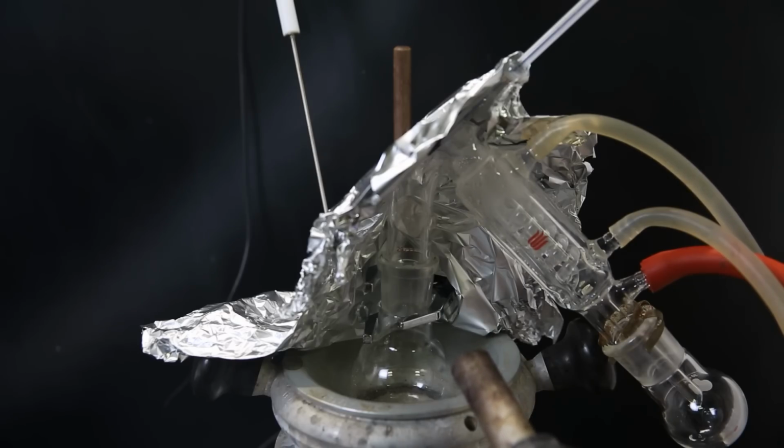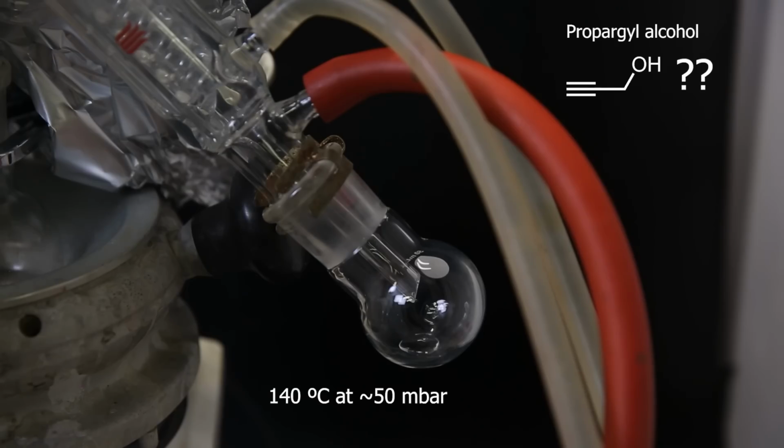At first, a clear liquid starts distilling over like before, at a temperature of around 140 C at around 50 millibars of pressure. In literature, it is said that propargyl alcohol is one of the side products, but if the liquid is propargyl alcohol, it is one, way too much, and two, the boiling point doesn't match, and actually matches 1,4-butyne-diol a lot closer. So maybe it's just impure and coming over with a lot of crap. Maybe the impurities make it liquid.